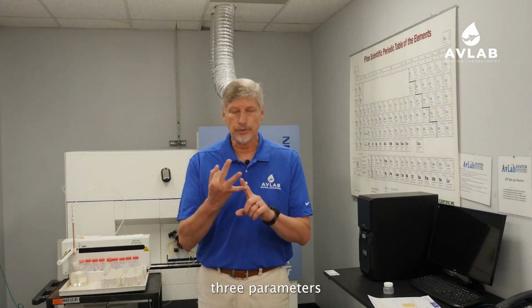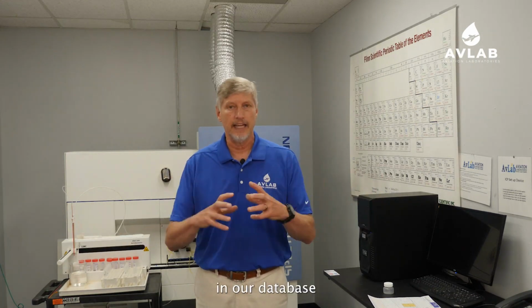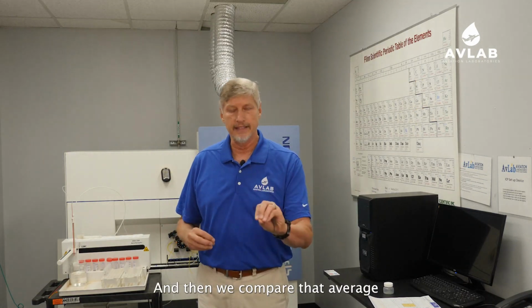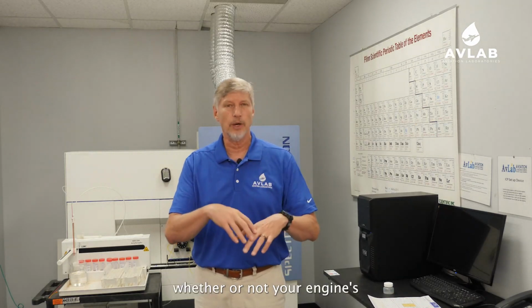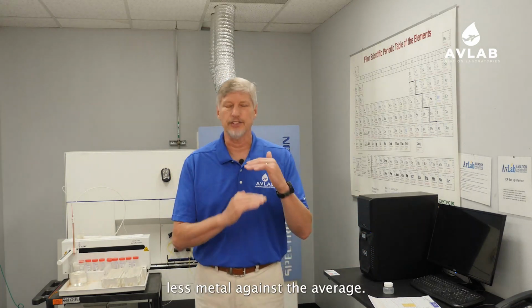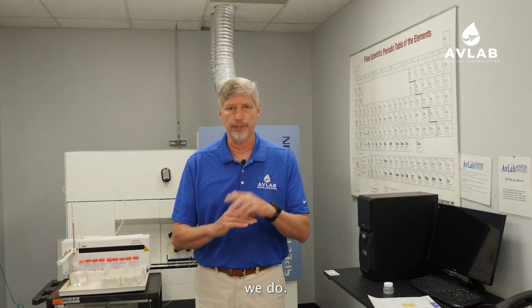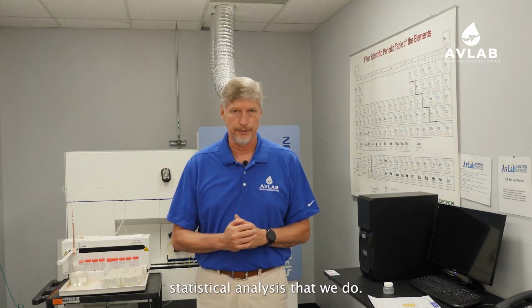And we use those three parameters to grab all of the data in our database that match those three criteria, and then we compare that average against your specific data to tell you whether or not your engine's making more metal or making less metal against the average. And that's the first thing we do. That's a comparative statistical analysis that we do.